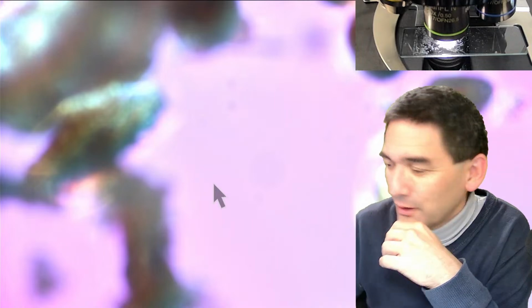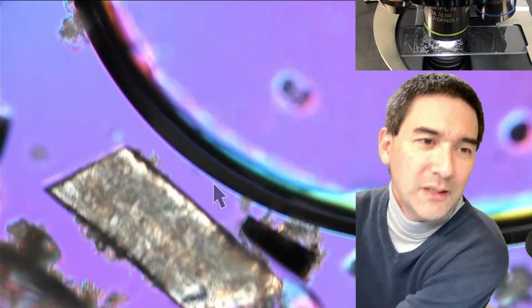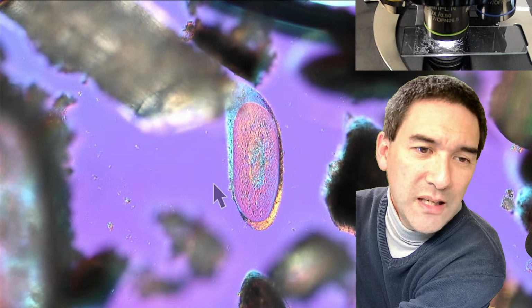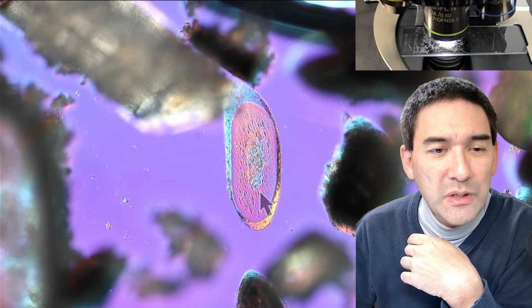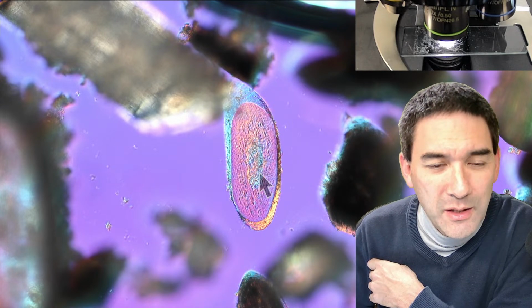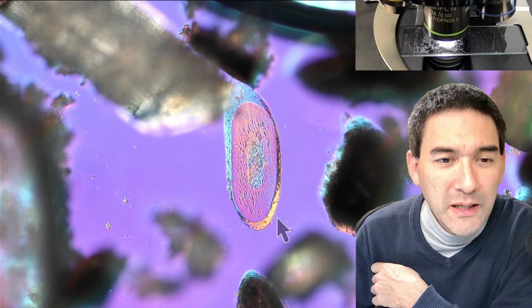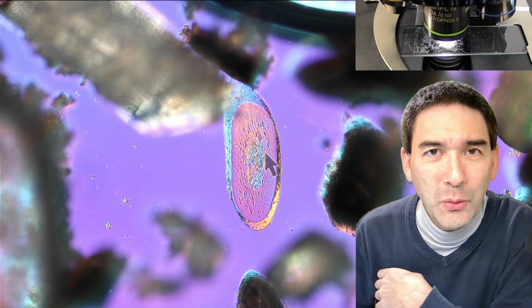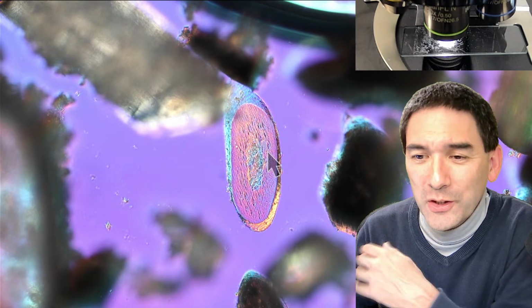Where is the scope? Here we go again. Okay, let's go down a little bit. Look at the colors. What I just wanted to show you again, in case you joined late, is how I started off. By shaving yourself, you get a very good and unique view of the cross section of the hair. Over here you can see the inside, that's the medulla, then the cortex, and on the outside the cuticle, an outside protective layer. That's one of the only ways that I know, without using embedding and fancy microtomes, of getting a cross section. Just wanted to share that with you.